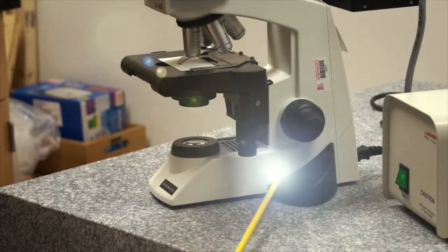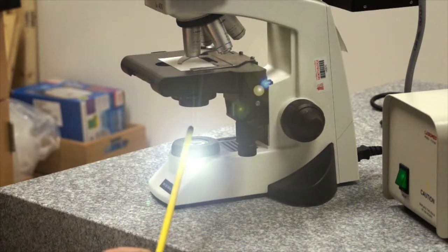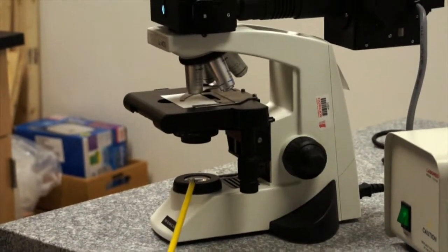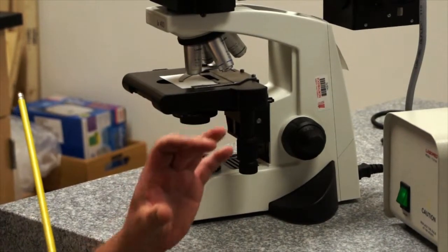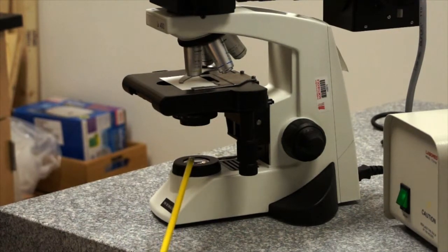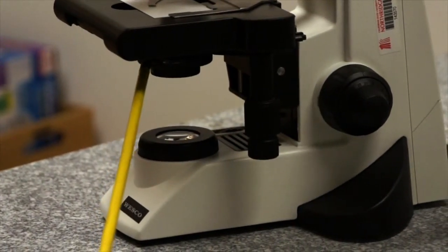That light travels from the bulb and the lamp housing up to a right angle mirror in the base, and then it comes vertically through the field diaphragm of the microscope. The field diaphragm is important, remember, because when we close it down, we can see it in the field of view, and it's also important for alignment. We'll show you how to perform that alignment in another section. The light travels through the field diaphragm and comes into the condenser. The condenser is an optical apparatus that does just as its name suggests. It condenses the light into a fine cone of light so that it can travel through the specimen on the stage and then into the objective.